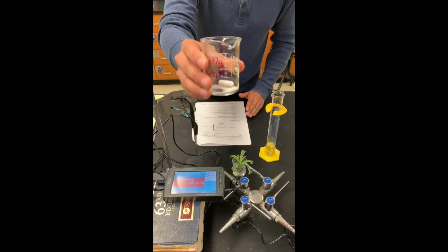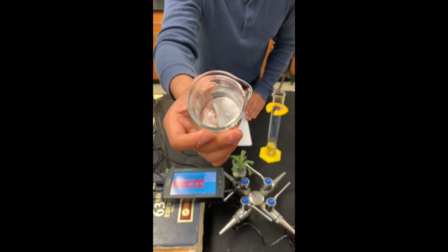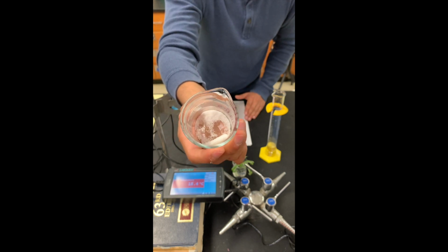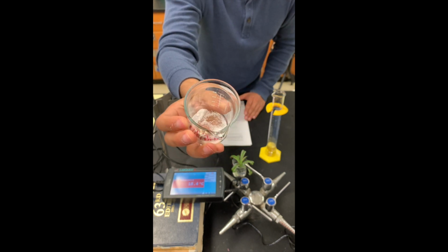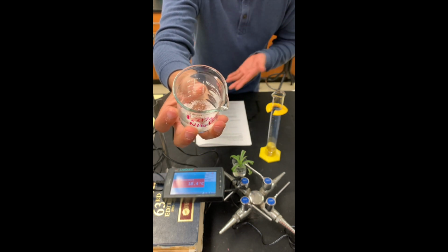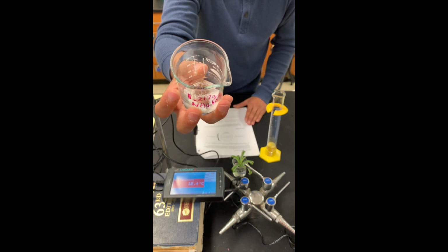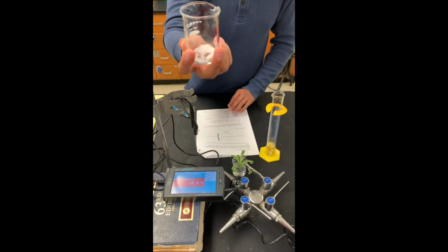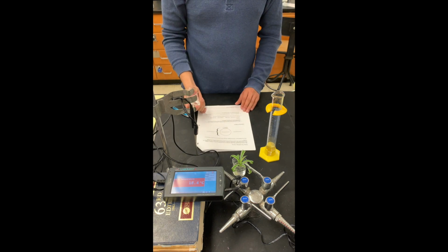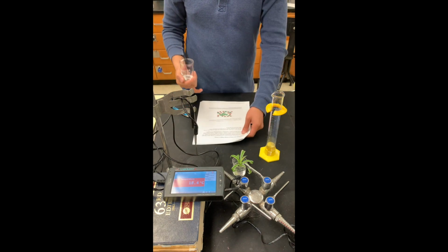So I will be zooming in a bit so you can observe the ammonium nitrate. You can also Google image powdered ammonium nitrate so you can see the color and the size of the crystals as part of the observations that the lab is requiring. So with this piece of information, you should be able to complete questions 1 through 3.